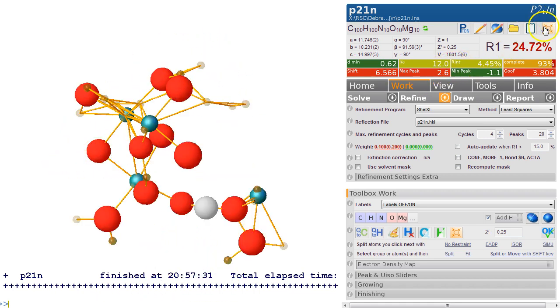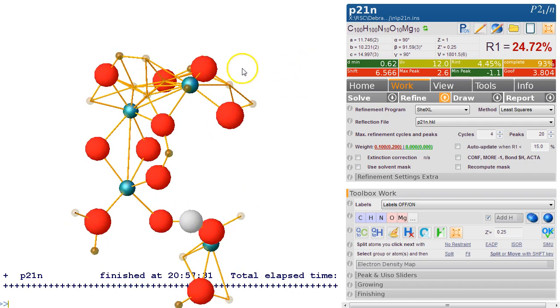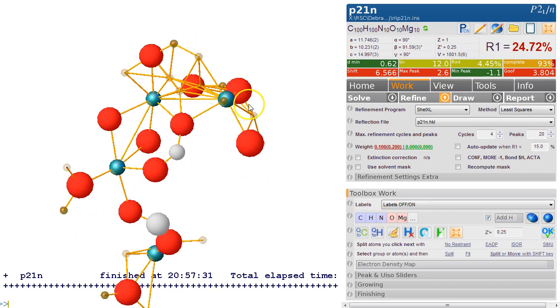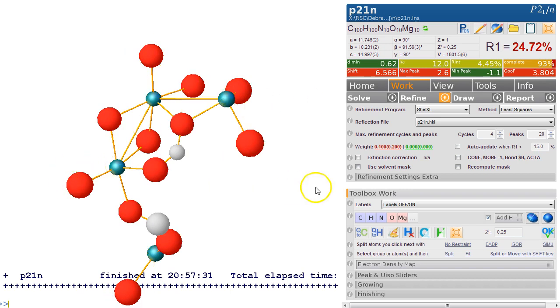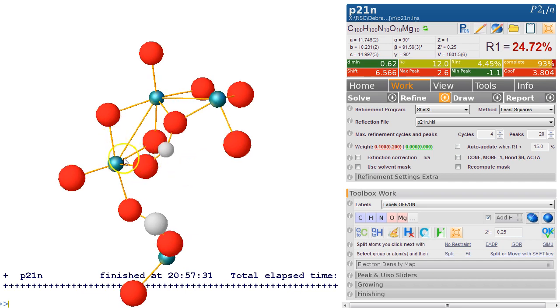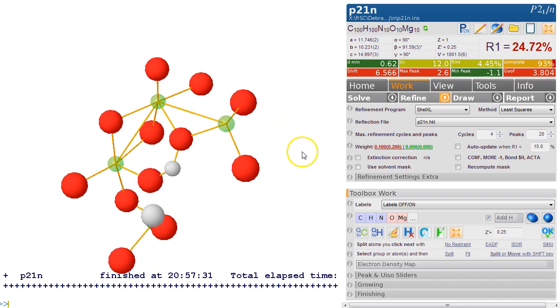Let's click on this and put everything together. So now we have the slightly better picture here. So there clearly is another carbon in here. Right, but something isn't right. So these magnesiums can't be magnesiums. They must be heavier than what we're seeing at the moment. So let's hover the mouse and see what it could be. So that's 2.1. Now that looks a perfect first row sort of transition element sort of thing. So let's try and make them, I don't know, let's try copper. So we go name CU and refine that.